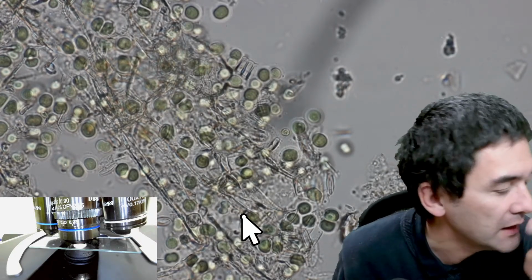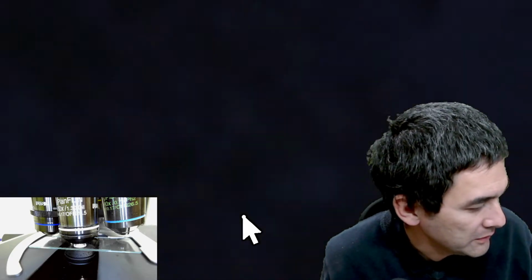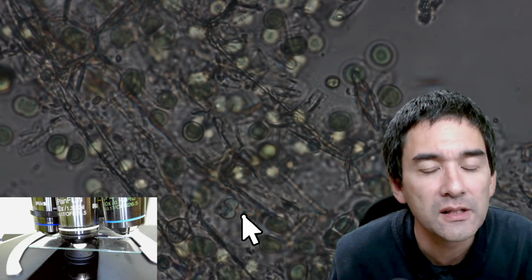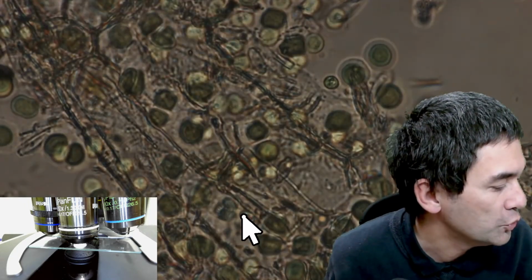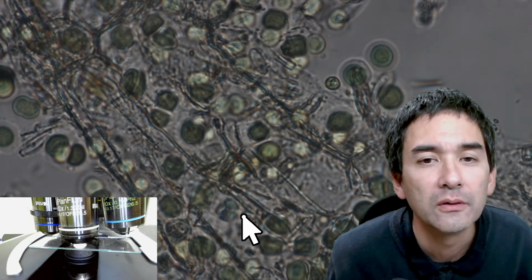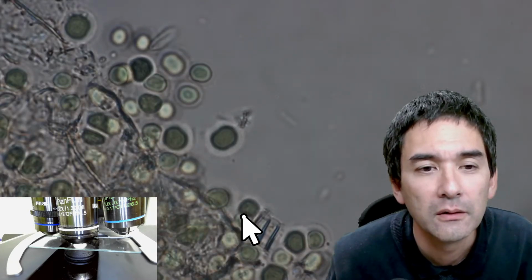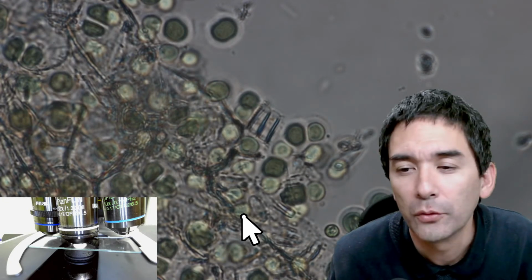And now let's have a look at how it looks without immersion oil. Okay, that's now without immersion oil. The light has to be adjusted as well. And okay, I'm just going to leave it at this setting. And this is how it looks without immersion oil. I'm going to also adjust the condenser here. There was a little bit of movement. So you see it's still kind of okay.